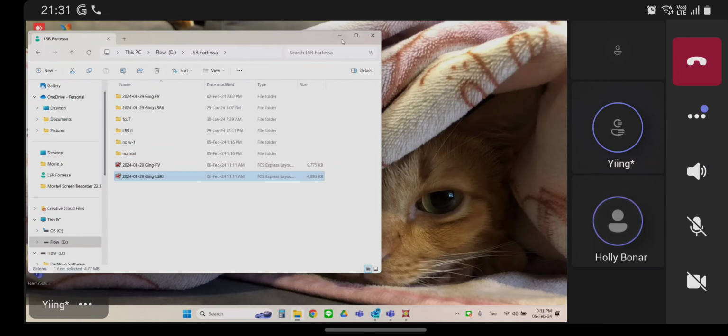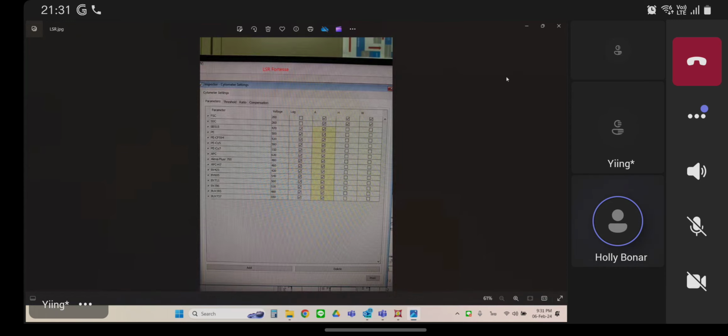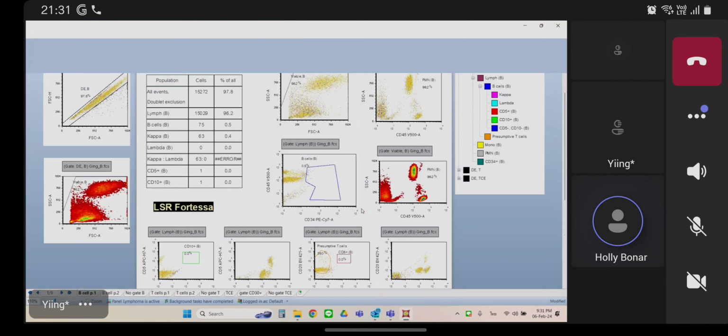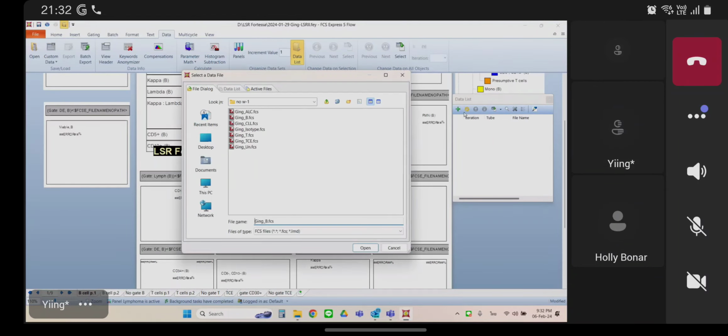And this layout works for 5 scatter parameters where you're not exporting. So like, for example, on this, I'm confused about the machine or the program. Well, when I say the date, bring your LSR settings back up again, please. Bring your LSR settings back up again. The data, right? No. Your screenshot from your LSR. Oh, screenshot. Okay. Sorry. Yeah.